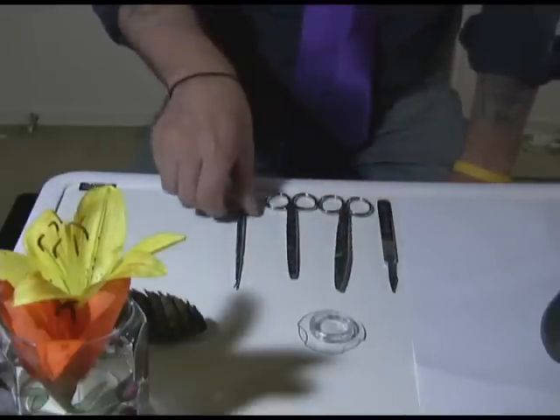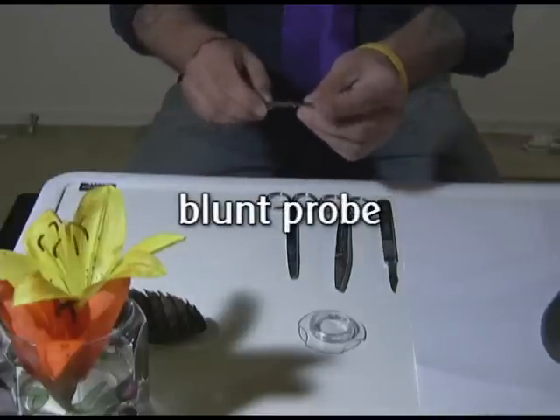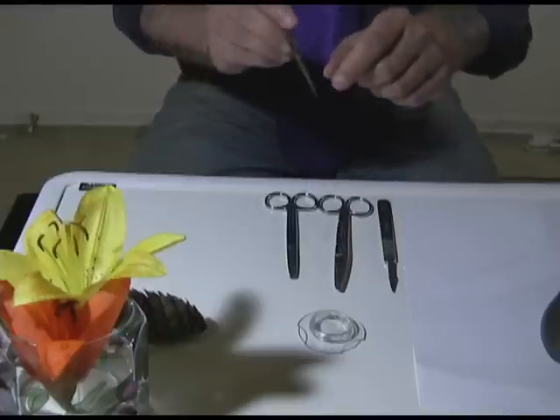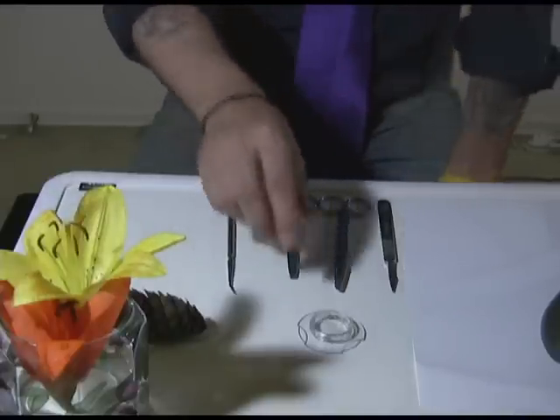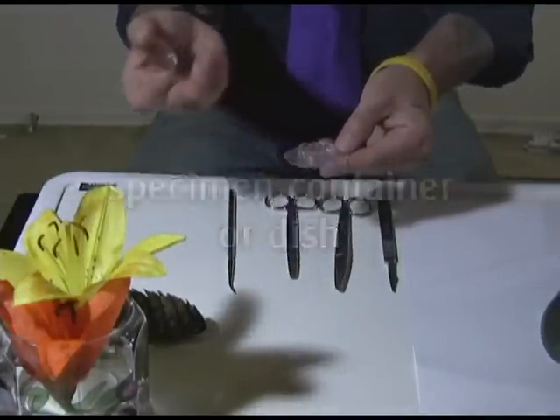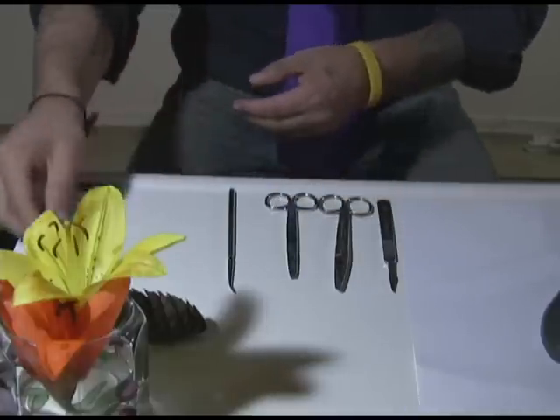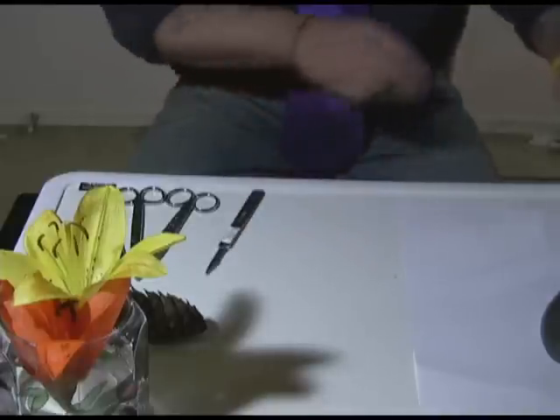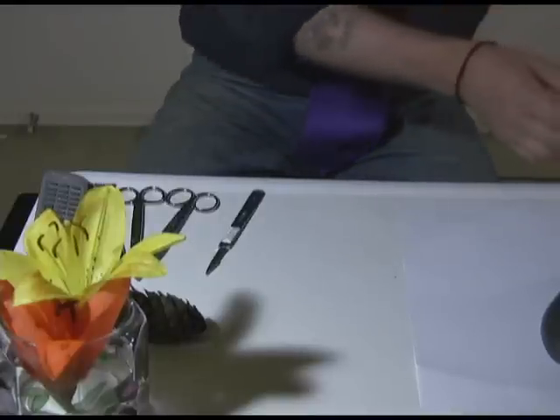Two different types of those. And this is called a dissection probe — this is a blunt probe because the end is not sharp, so you can use it to tease apart structures without damaging them. I've also got a little specimen container here that we can put something like pollen in or maybe another little piece of the flower, and we can examine that under the microscope. And speaking of microscopes, here's something that I just picked up and I think I'm going to have a lot of use for, especially in a video like this.